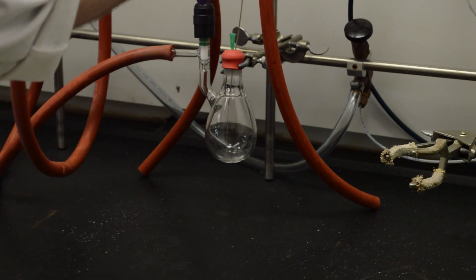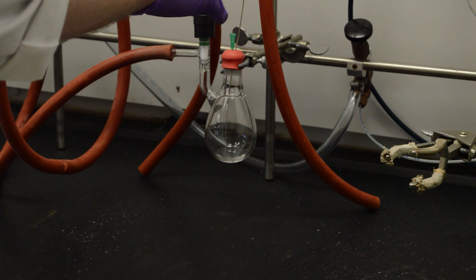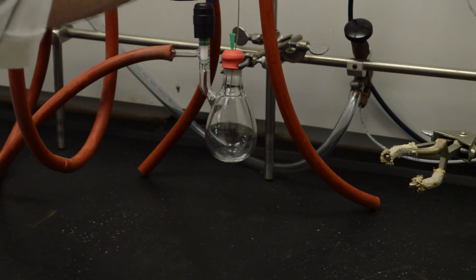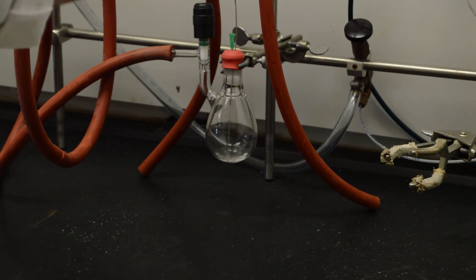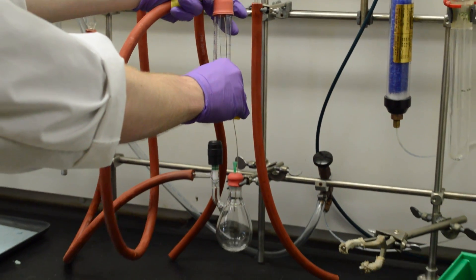So in your reactions, you're going to want to pour 15 milliliters into this. It doesn't need to be exact, but you can just sort of follow it along the graduated cylinder as it goes to make sure you get the right amount in there. So keeping it lifted or probably up above the other should keep the flow rate fairly high.